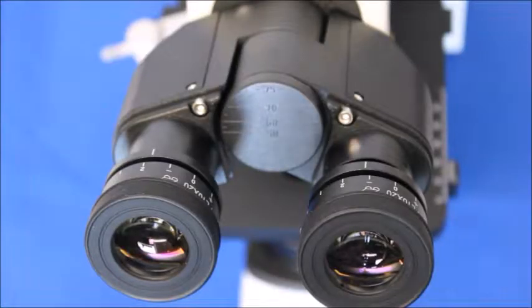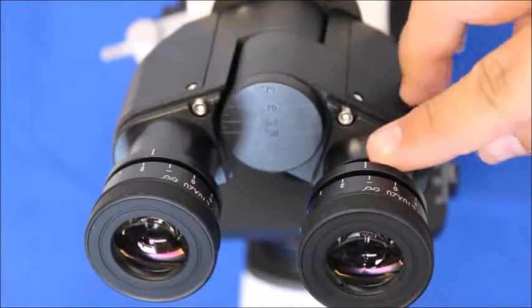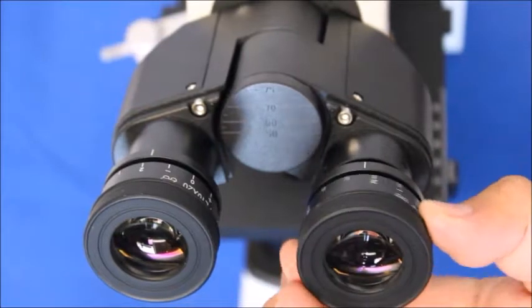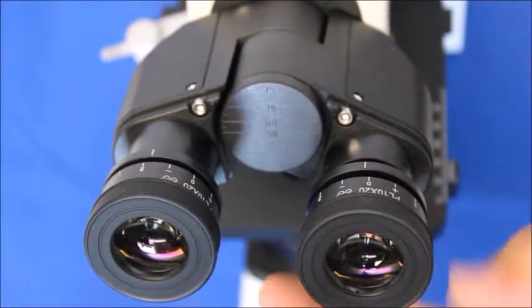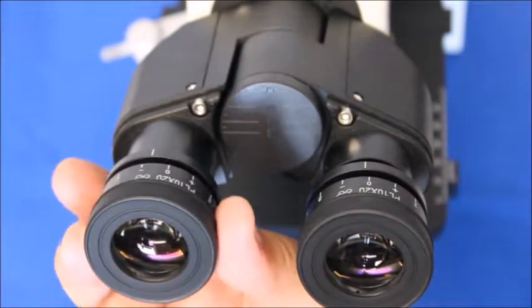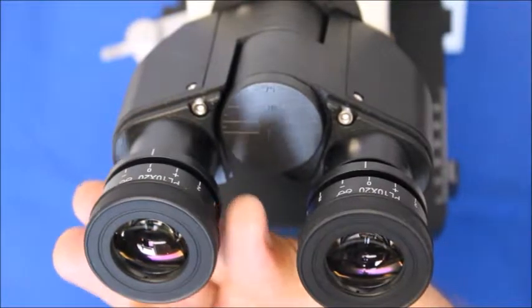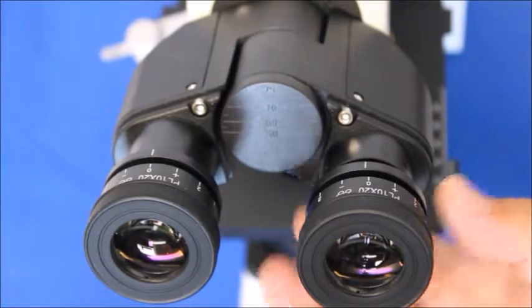Okay, now we're going to adjust the diopters. Now on the top of each eyepiece you'll notice there's this line right here and then you've got hash marks with numbers on here. So you just want to set those to zero. And you can always check out our video on how to use a diopter if you have any questions on that. So just set those to zero.